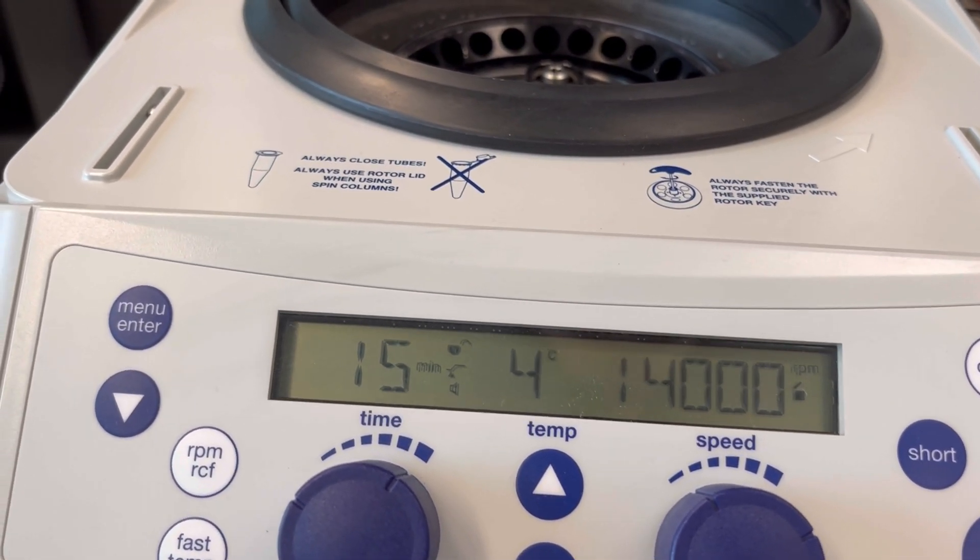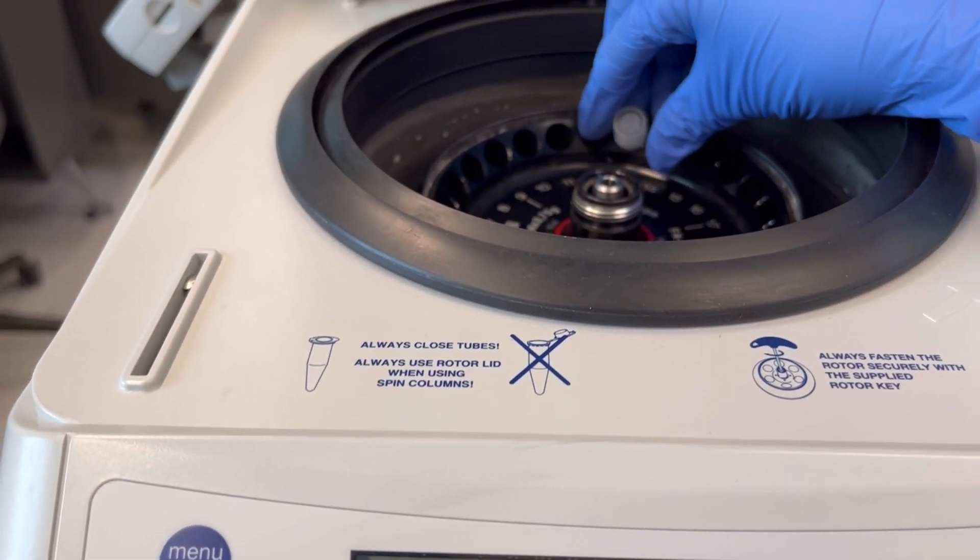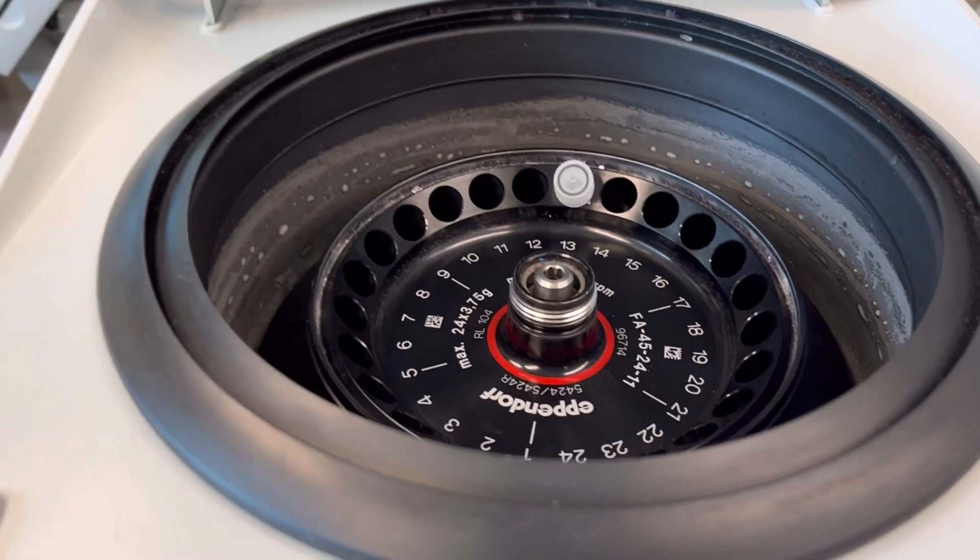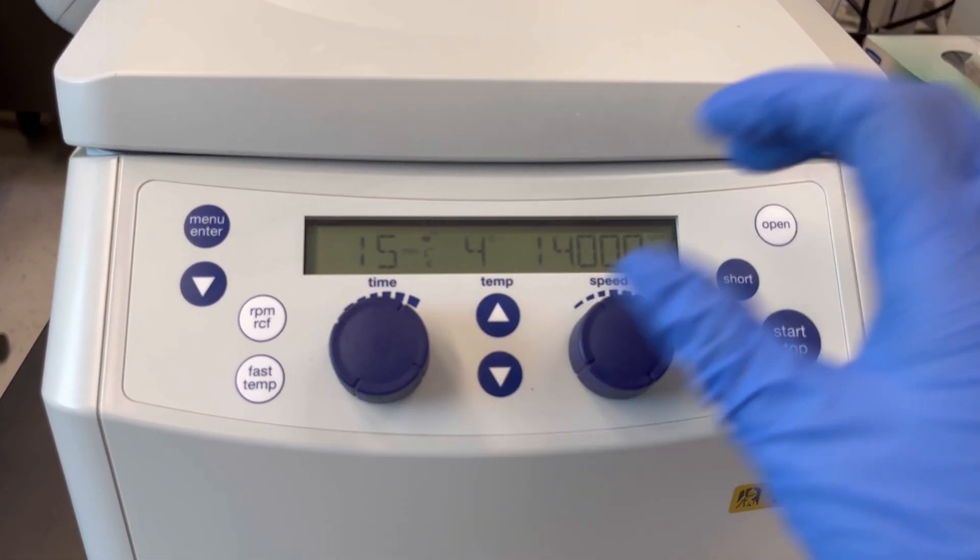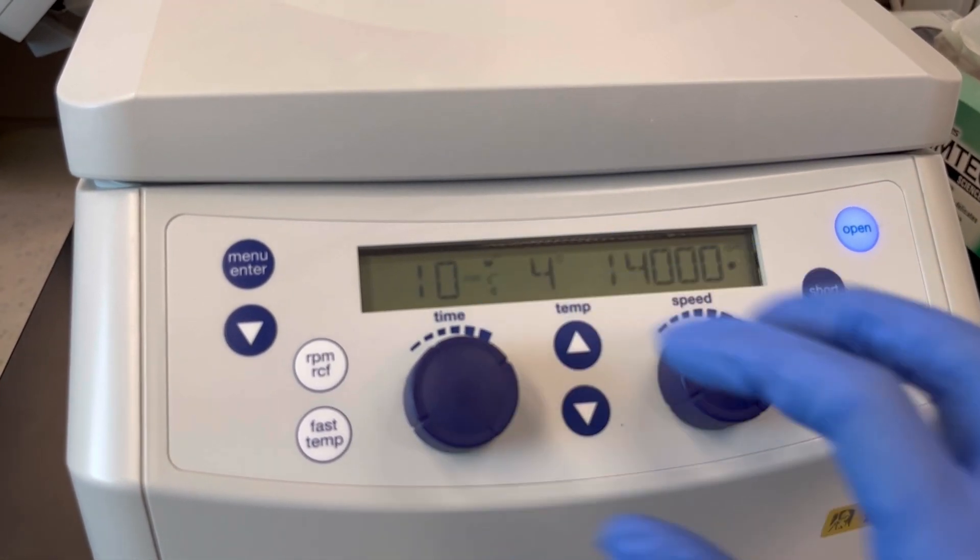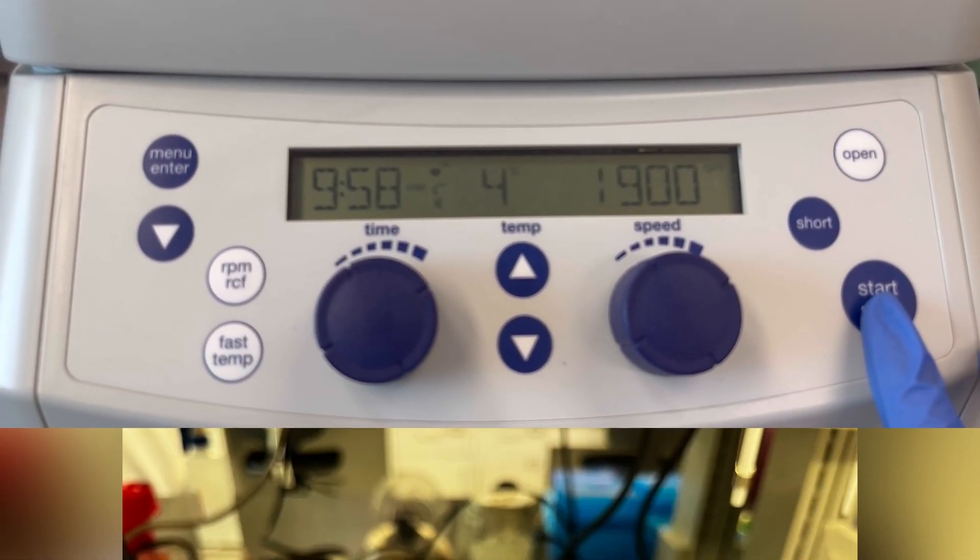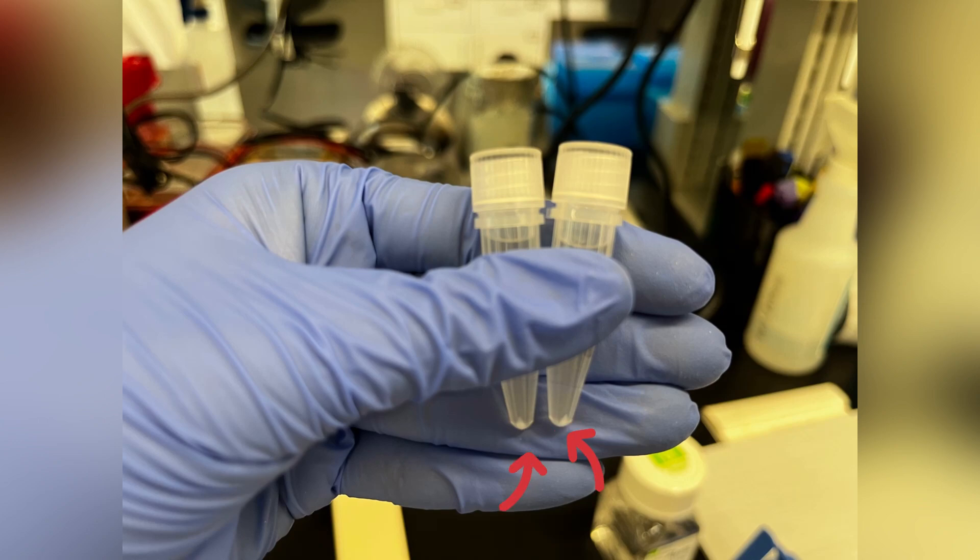After incubation, again centrifuge for 10 minutes at 14,000 rpm. After this you would be able to see a white pellet which is the RNA.